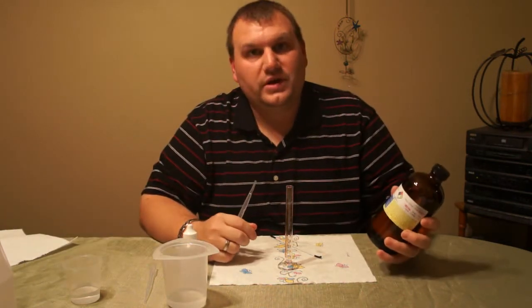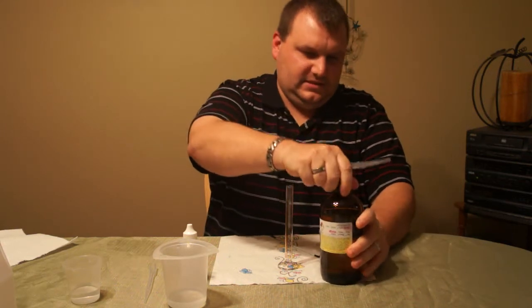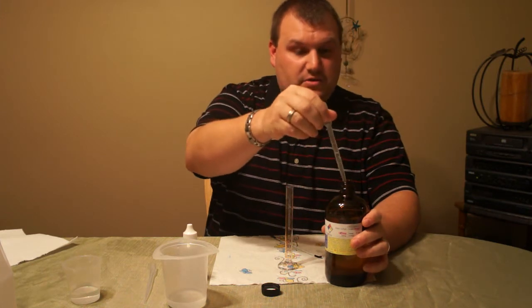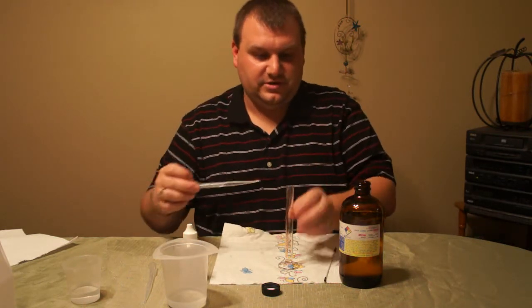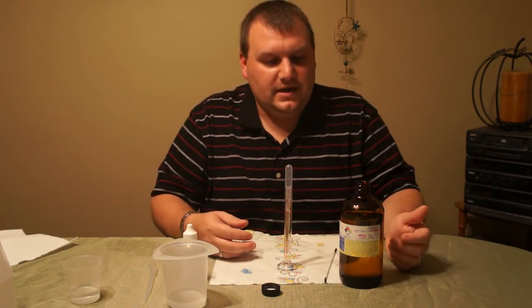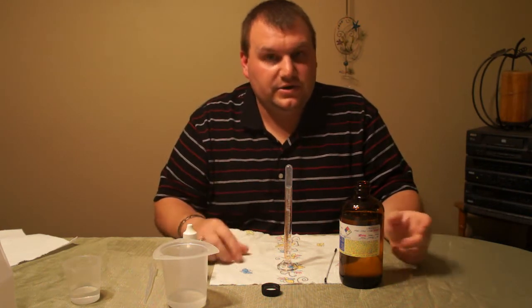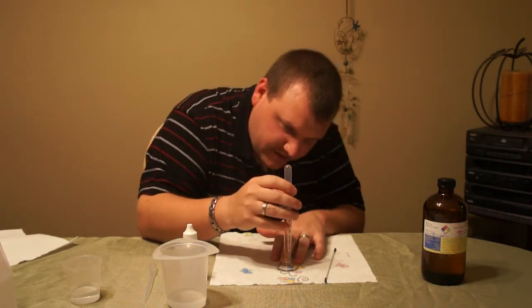I have some what's labeled 24 mg unflavored nicotine. It is a 25-75 PG-VG mix. I'll give it a quick shake. I've been asked: can nicotine separate in the mixture? The correct answer I got from chemists is no. However, about a month or two ago, I got some 36 mg 100% VG mixture that actually tested to 54, and after I shook it up, it tested properly to 36. I'm thinking either it wasn't mixed fully from where it came from, or maybe my testing could have been off initially.